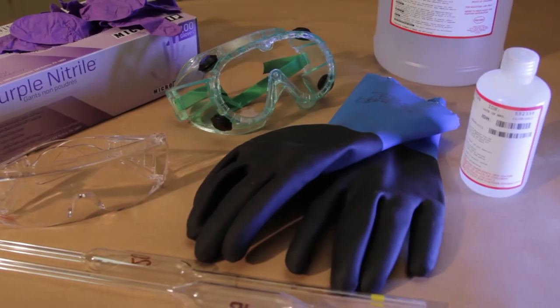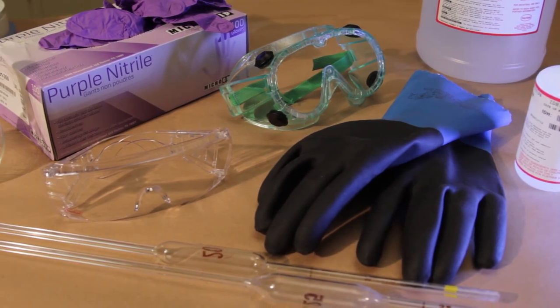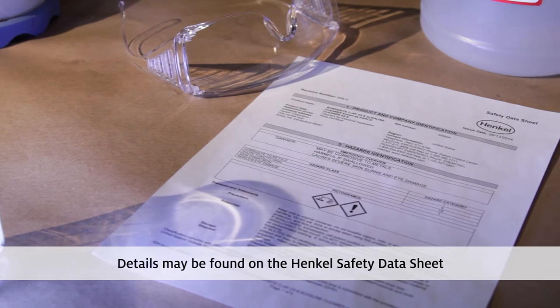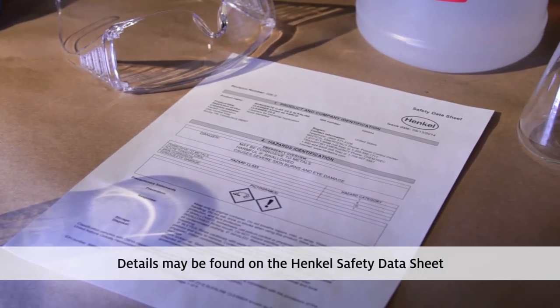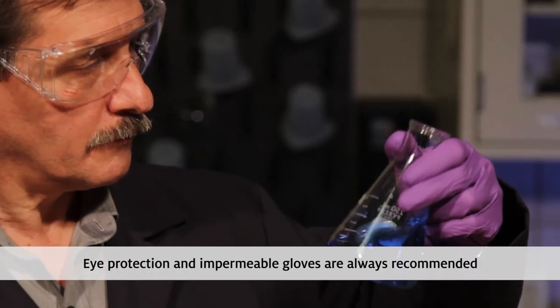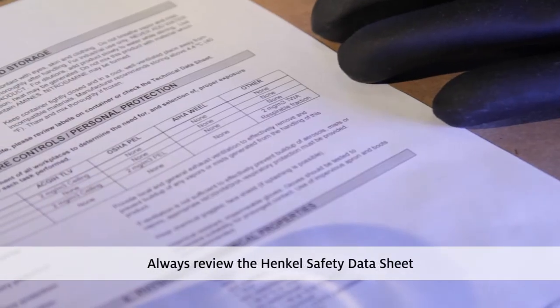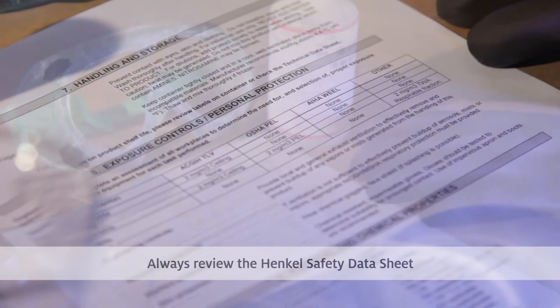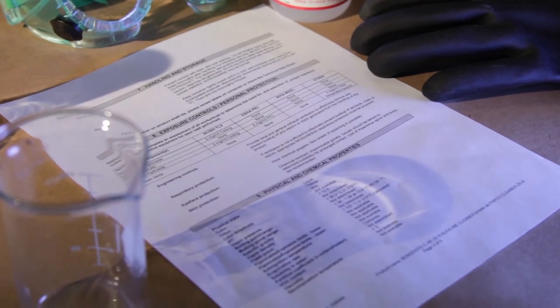It is important to wear the correct protective equipment when handling chemicals and glass test equipment. Details of recommended safety equipment may be found on the safety data sheet for the Henkel product that you are using. Eye protection and impermeable gloves are always recommended to avoid exposure to chemicals. Always review the safety data sheet before using a material for the first time so you understand any safety risks and what PPE may be required.